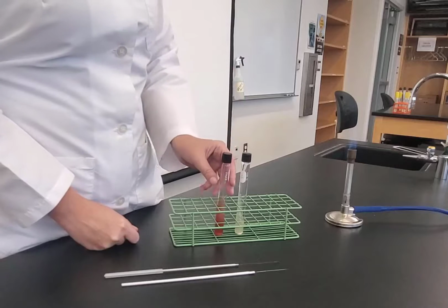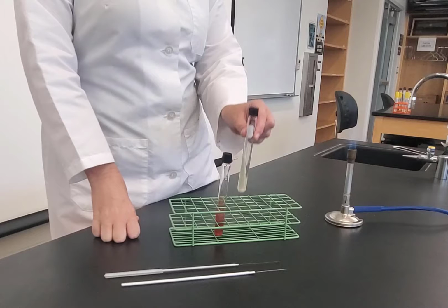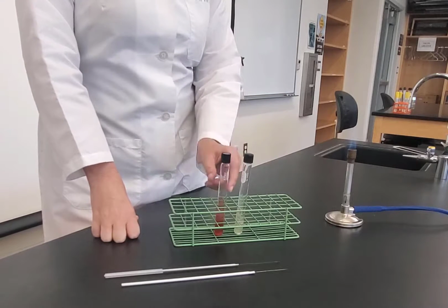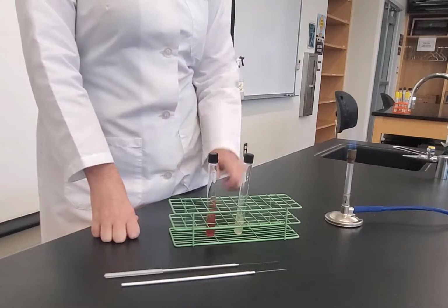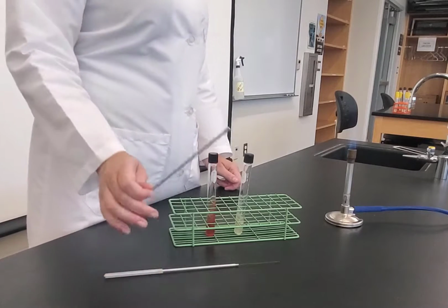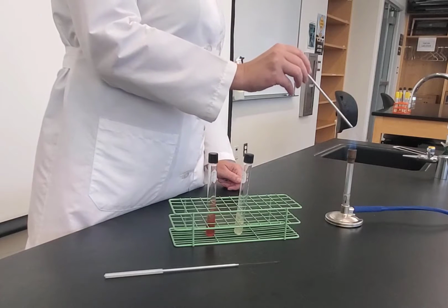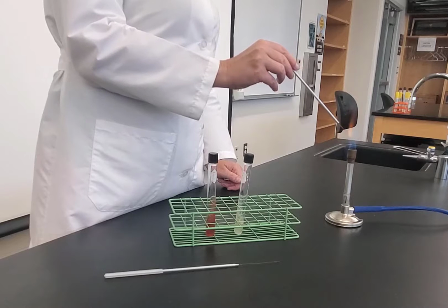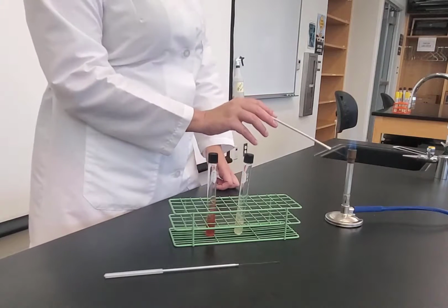For this experiment, we would have 7 different organisms that we would test. Again, I'm just going to demonstrate 1. I am going to demonstrate E. coli. Your tubes would all be well labeled so that when you have 7 of these, you'd be able to tell what is what. So I'm going to start with the needle, and I'm going to do my stab inoculation first. I take my needle, and I'm flaming it, and then I'm going to let it cool.